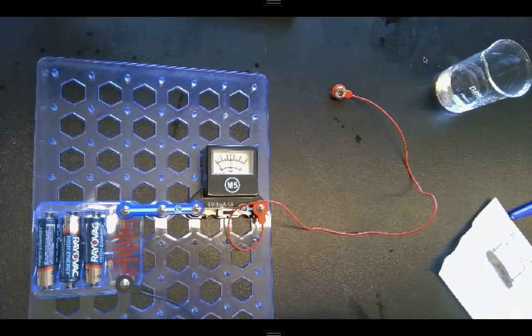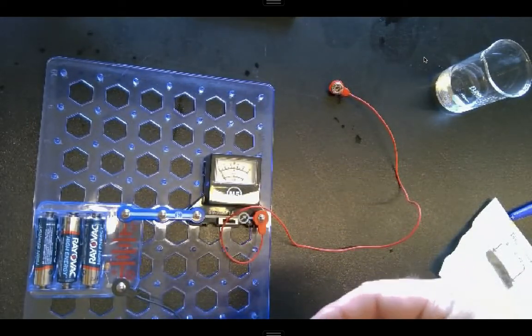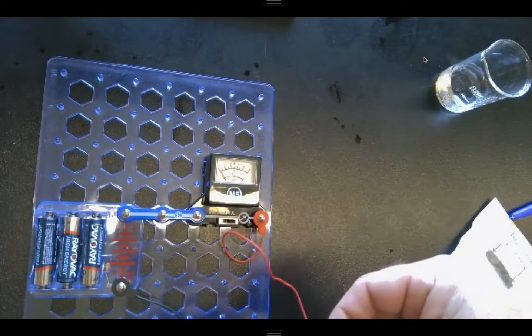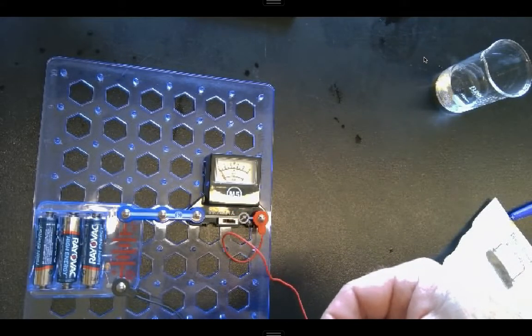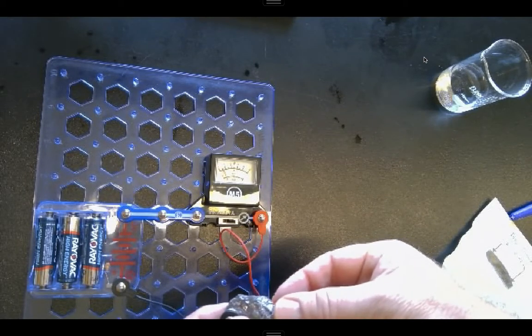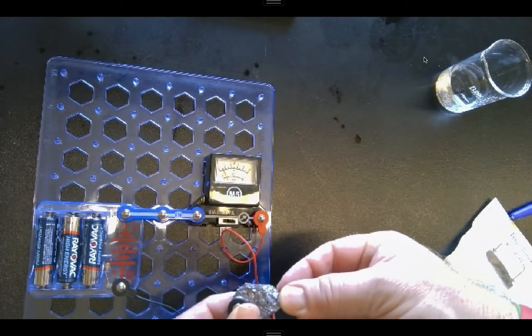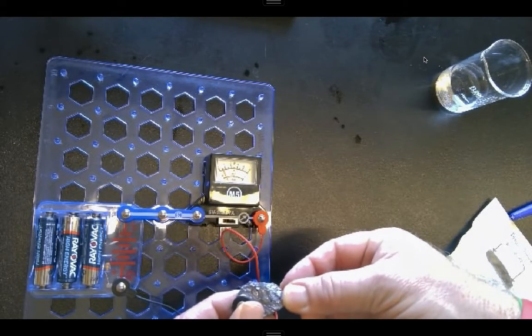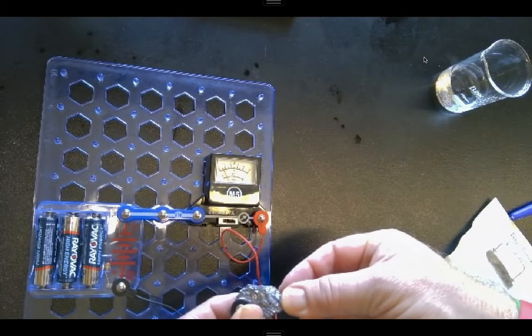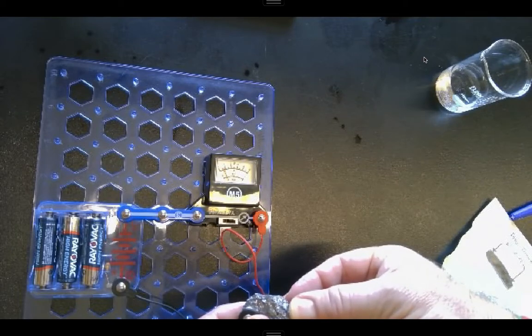Try our silicon again. Make sure it wasn't just my battery here. Well, now we got a little something happening. You see, it's going to register here now on my 1 amp setting, and it goes to, hard to read exactly. Does it maybe 0.2 amps? I can get it up to go through there.